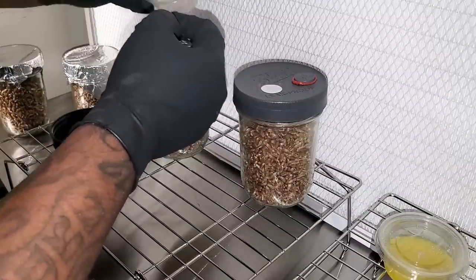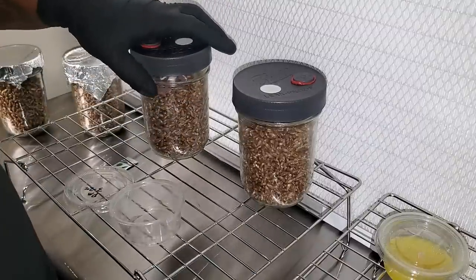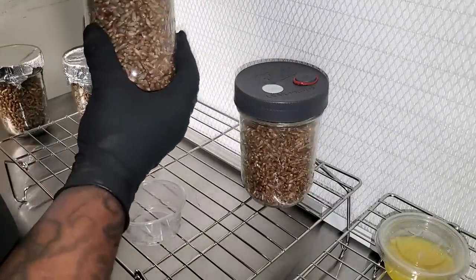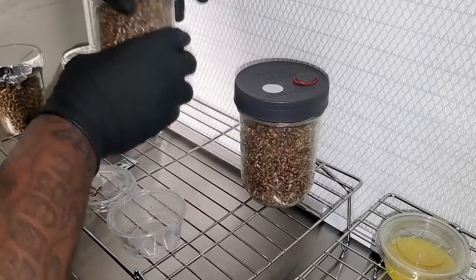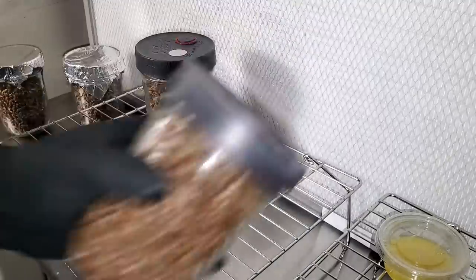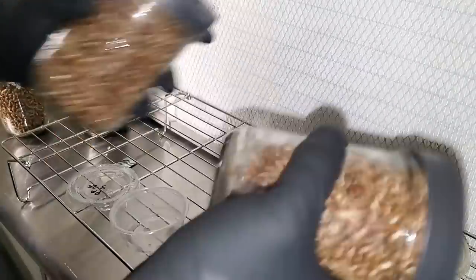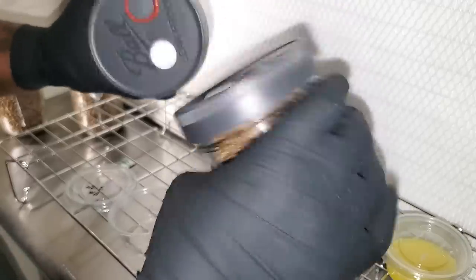One thing I wanted to mention: if you have mycelium growth inside your cup and you start seeing some contamination, you can transfer the healthy mycelium into another cup and keep it going. Earlier in the video when I thought I had contamination I just threw the cups away, but you can actually transfer healthy mycelium out of a contaminated cup, put it in a new cup, and keep it going.